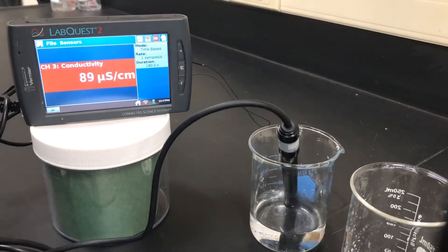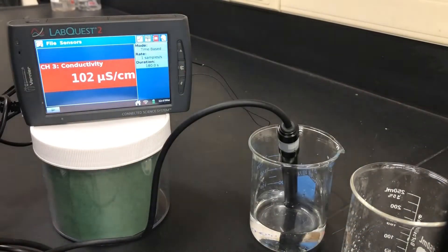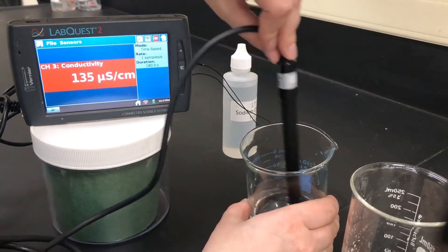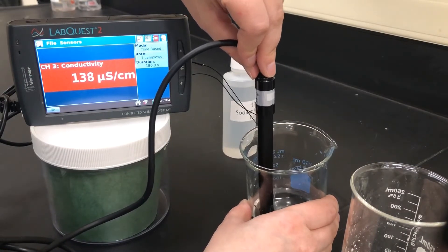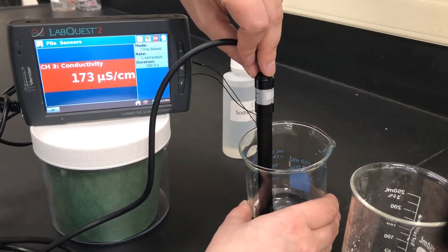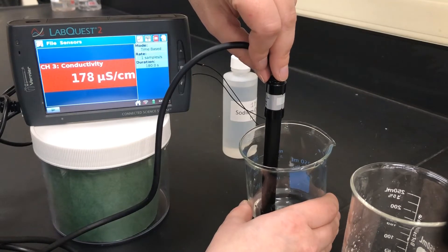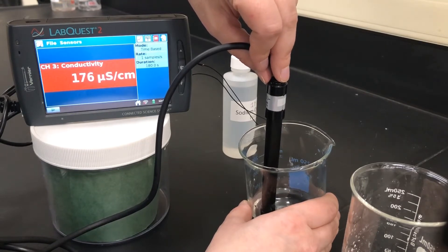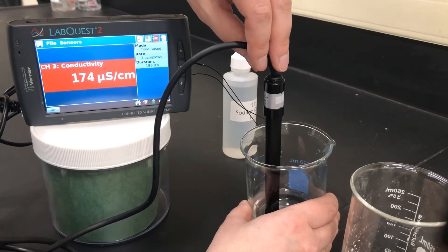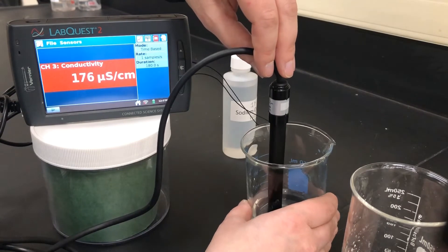I will now add drop number two of sodium chloride. I'm going to use my conductivity tester to mix it up and allow the number to stabilize. 176 for two drops of sodium chloride.